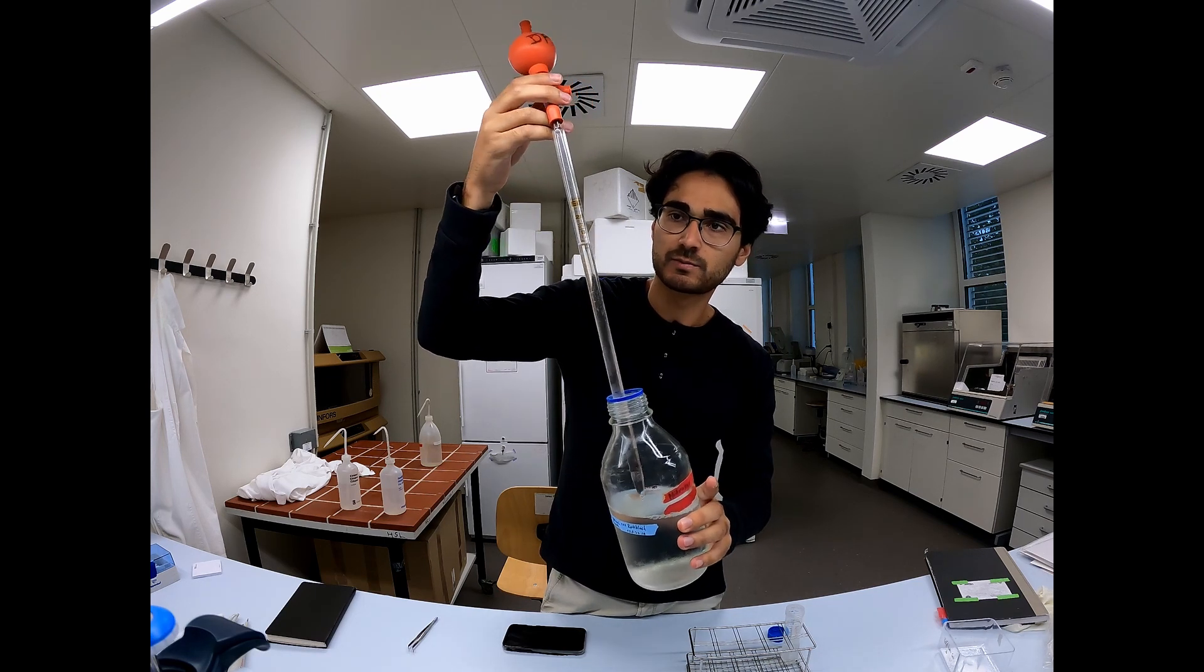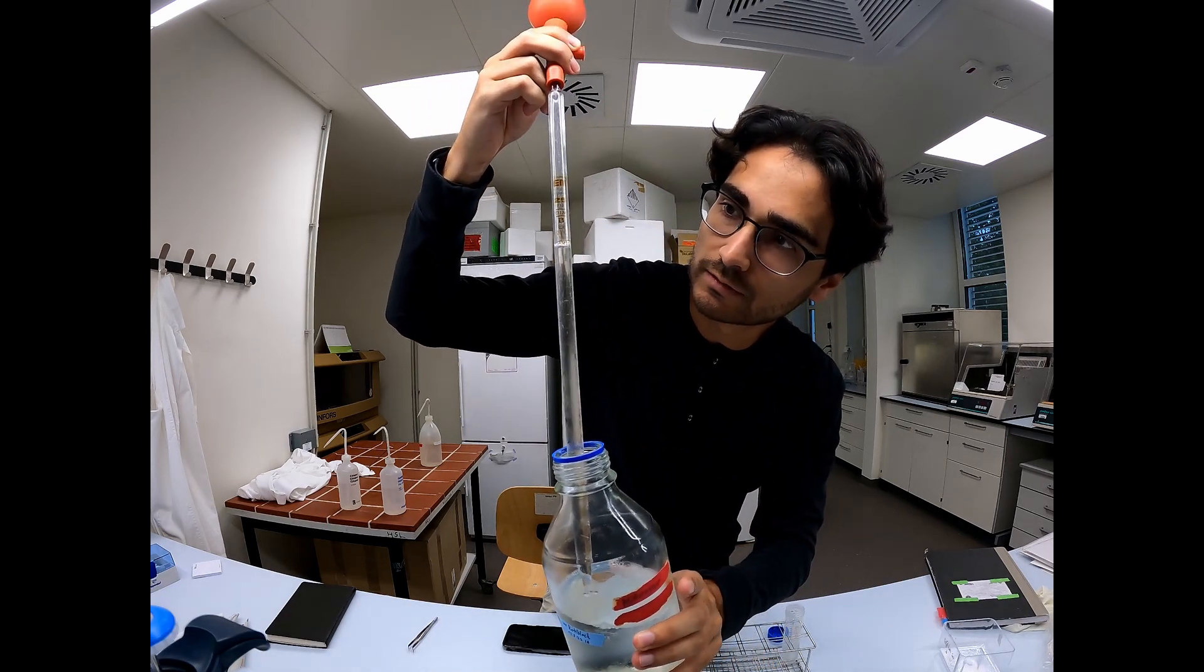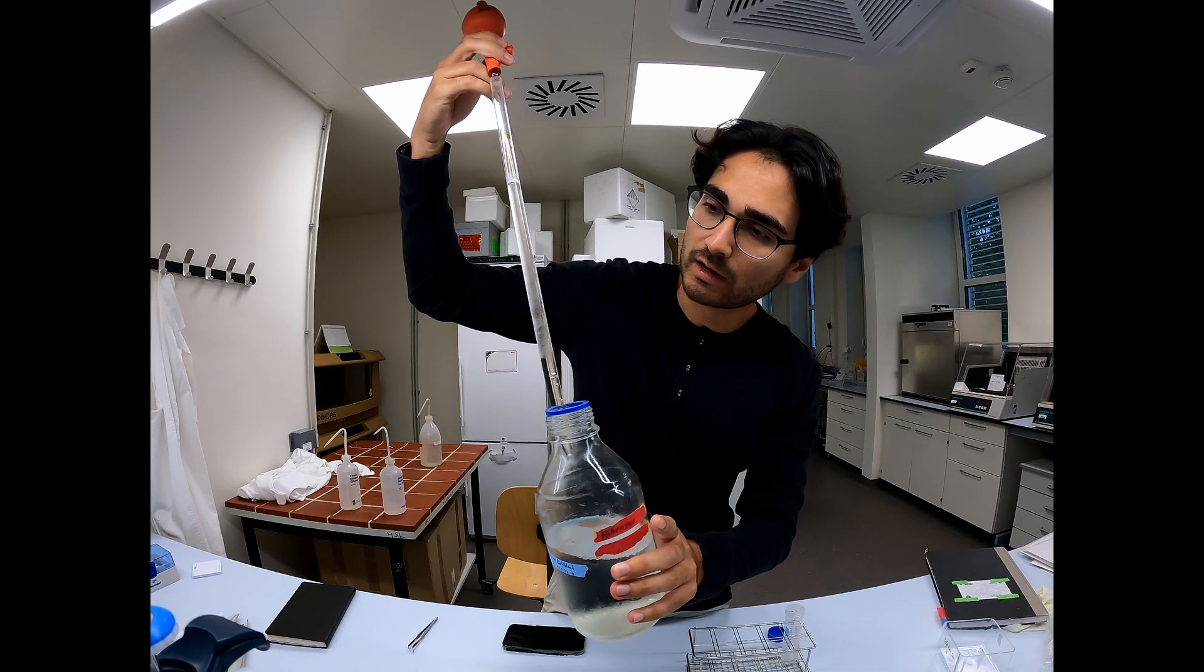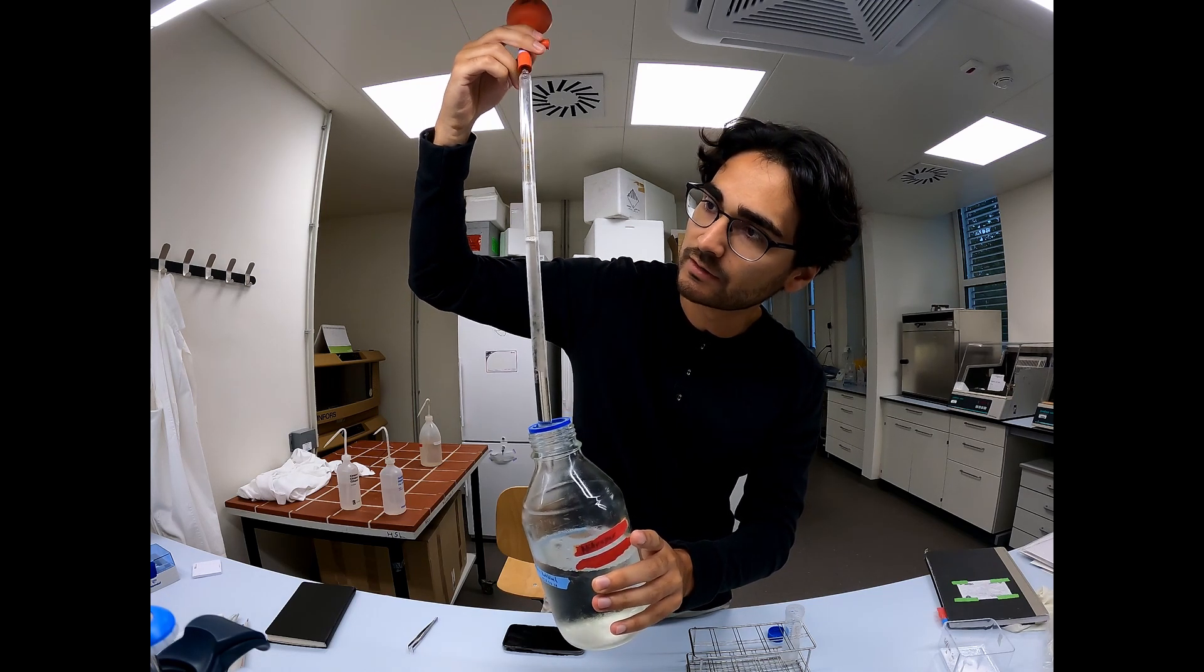And when you use one of those pipets, they are very, very precise. So if I adjust it to zero and I eject now five milliliters, I really get out five milliliters.